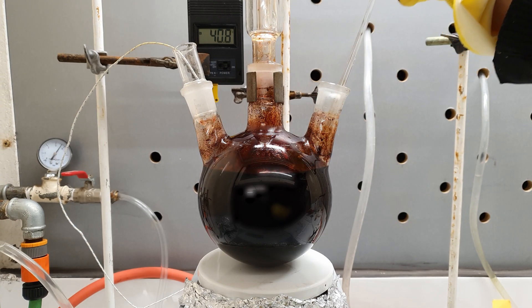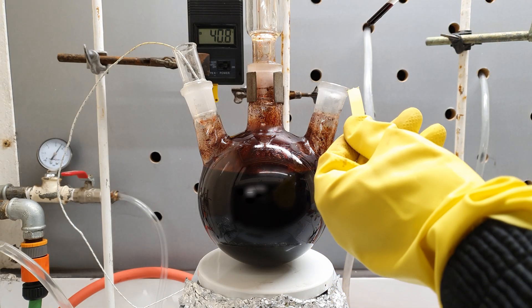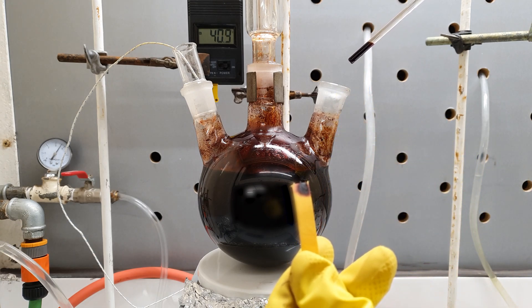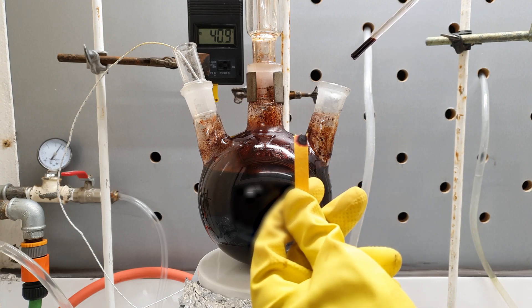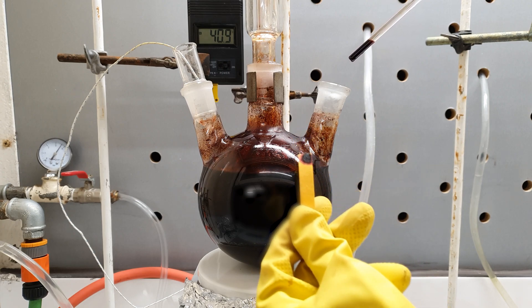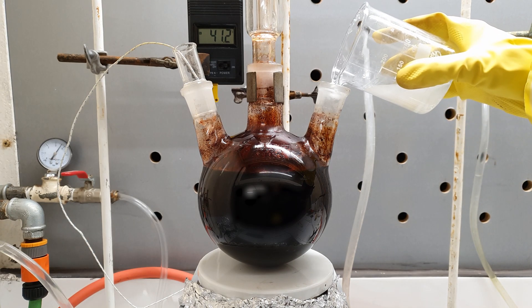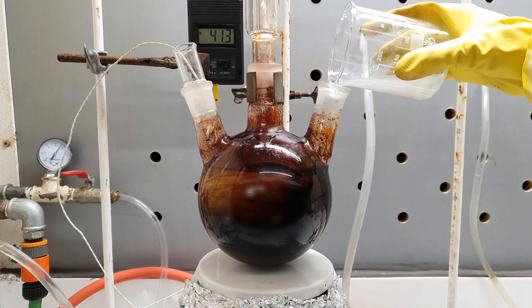When the temperature reached 40 degrees Celsius, I opened the flask and measured the pH — as you can see, it was acidic. Not all the diazonium salt would have been able to react with iodide even if it was in excess; some of it reacted with water, forming phenol. Phenol is a weak acid, so at basic pH it would be a non-volatile salt. We wanted it to be non-volatile, so I started adding sodium hydroxide solution until it became basic.